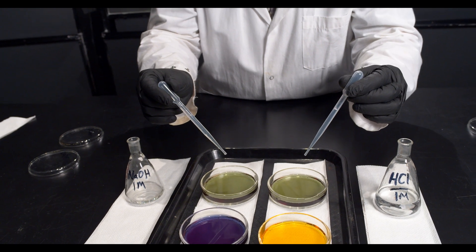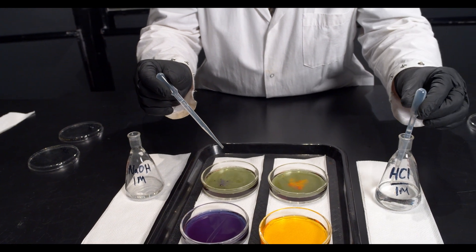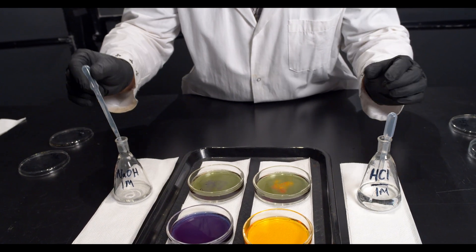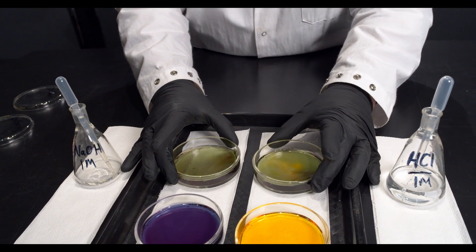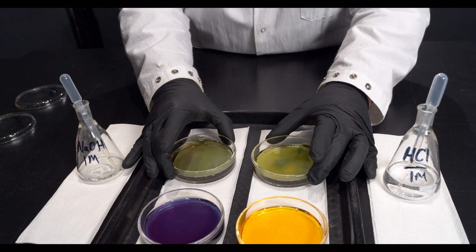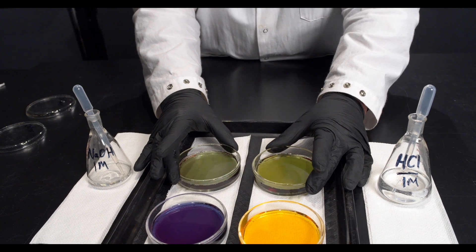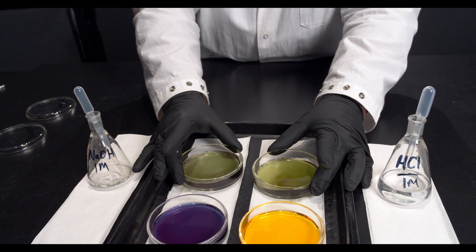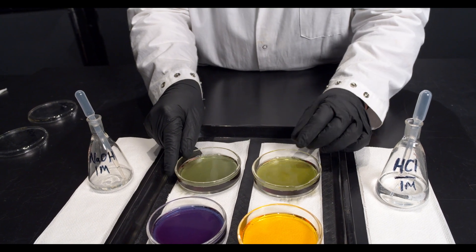So now I'm going to add 1, 2, 3, 4, 5 drops, and 1, 2, 3, 4, 5 drops. And let's see what happens. So even adding a significant amount of acid and base only changes the pH a little.